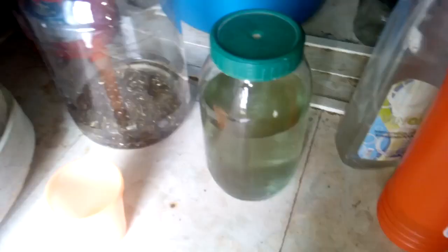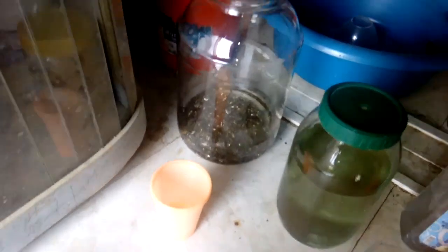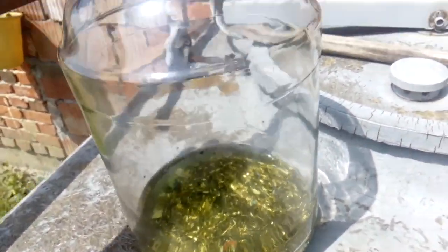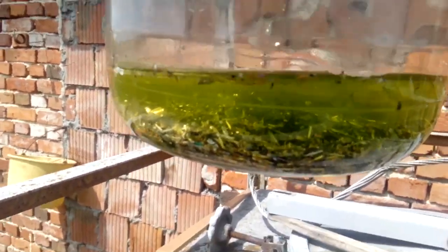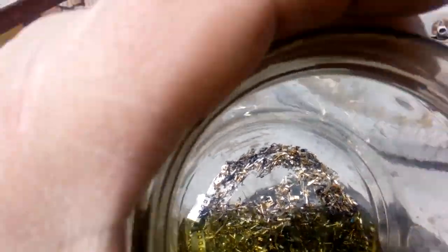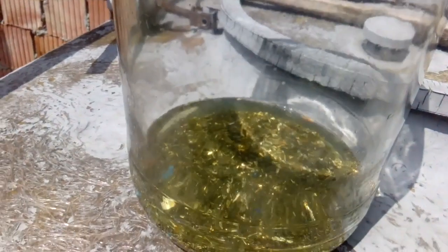Okay, let's see what's going on. I put this on the sun for a little heat and already — you can see — we got a good reaction. After one hour the solution started to turn green, which means the copper is going into the solution. If you look at the pins they already start to go black — some pins, some not — but they have time. This is after one hour; we'll leave it till tomorrow.